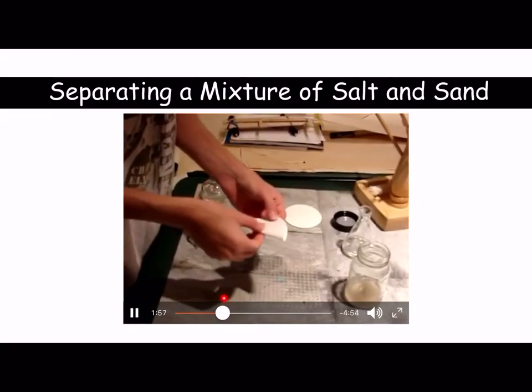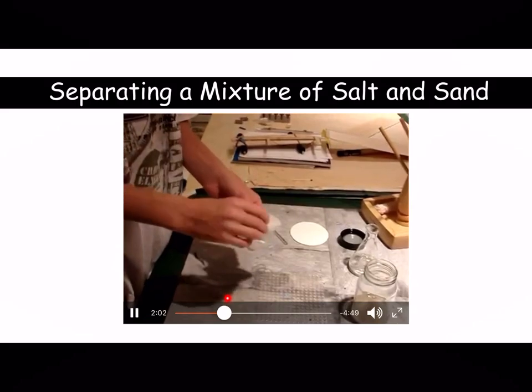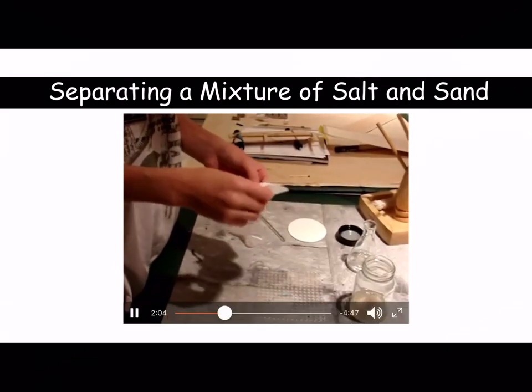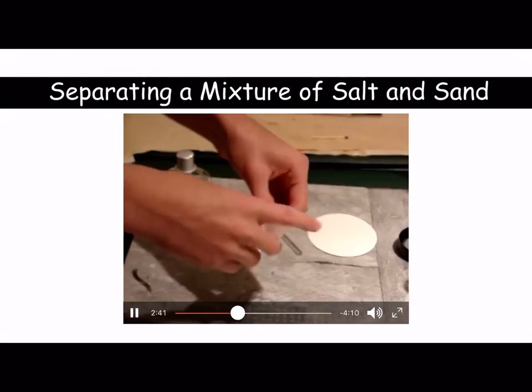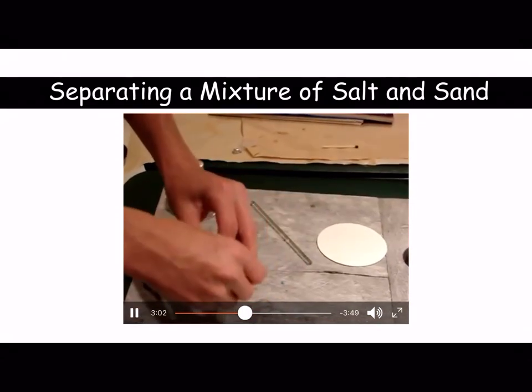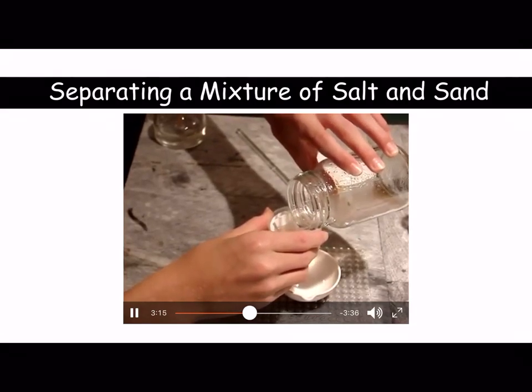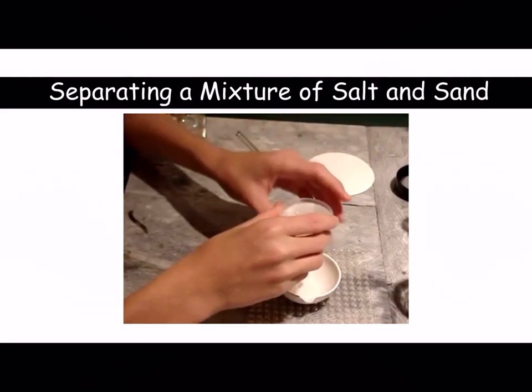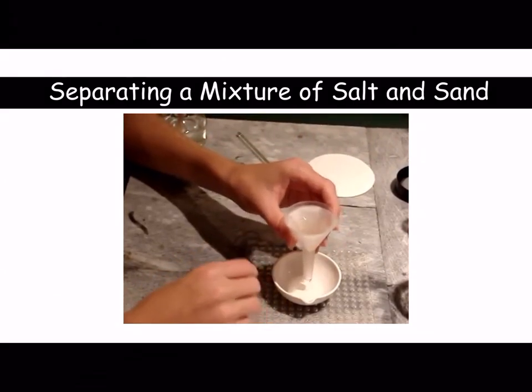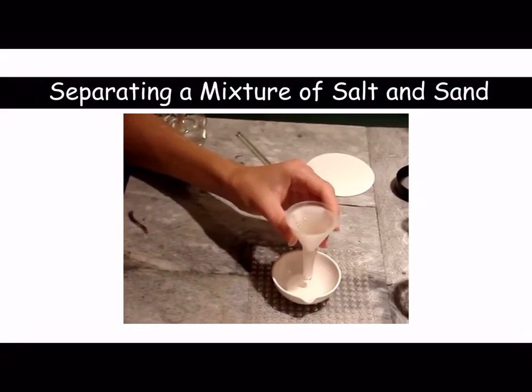Then you would put it through your filter paper. So we've looked at making fluted filter paper before, just going through that again. So we flute the filter paper, pop it into the funnel, and we would pass it through the filter paper. Now what you'll see is the residue remaining on the filter paper, and the filtrate, which is the salty water, coming through into an evaporating basin.